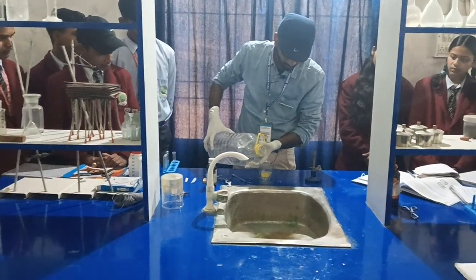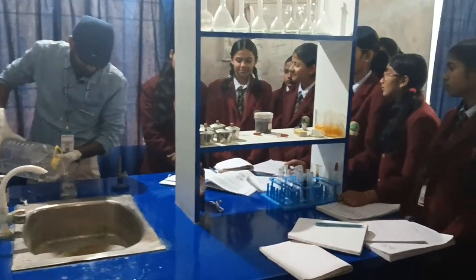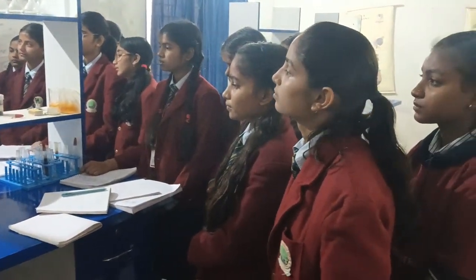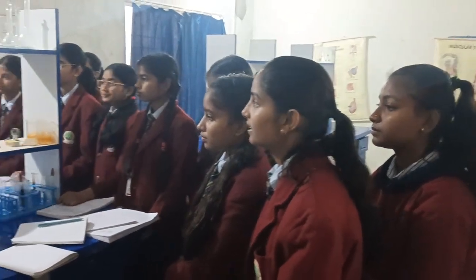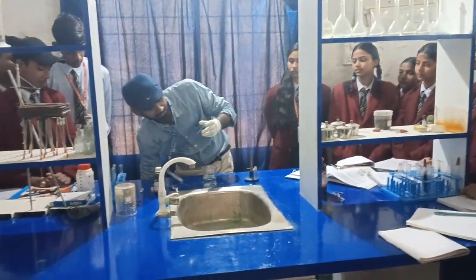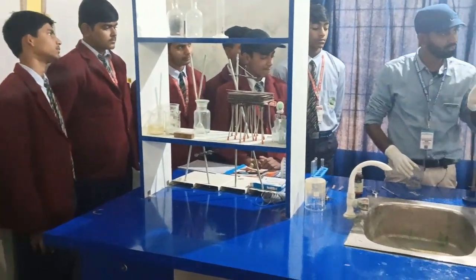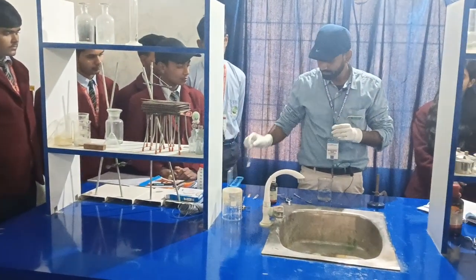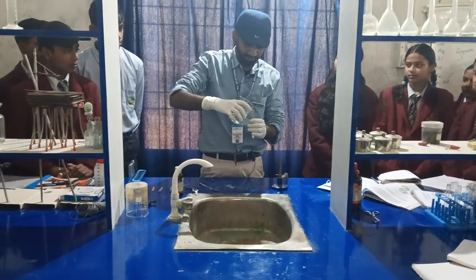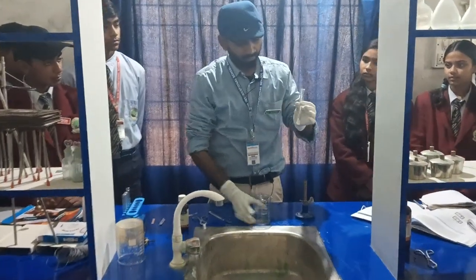Can we use tap water? Of course we can, but tap water has many impurities which can hinder our experiment and disturb the results. This is why we use distilled water. In fact, in any chemical reaction, we should always use distilled water only.